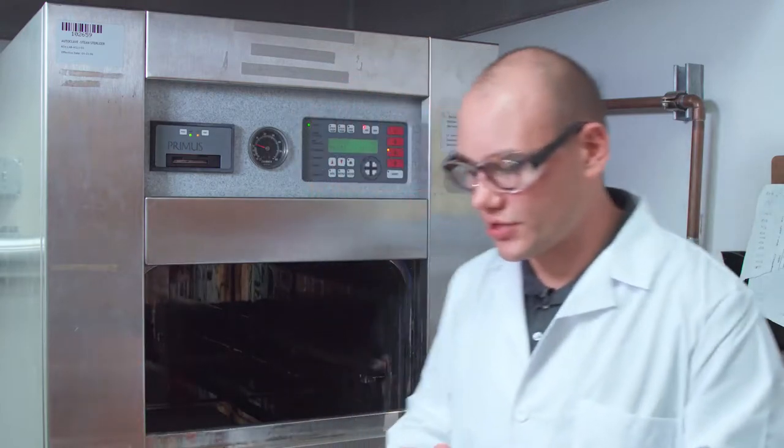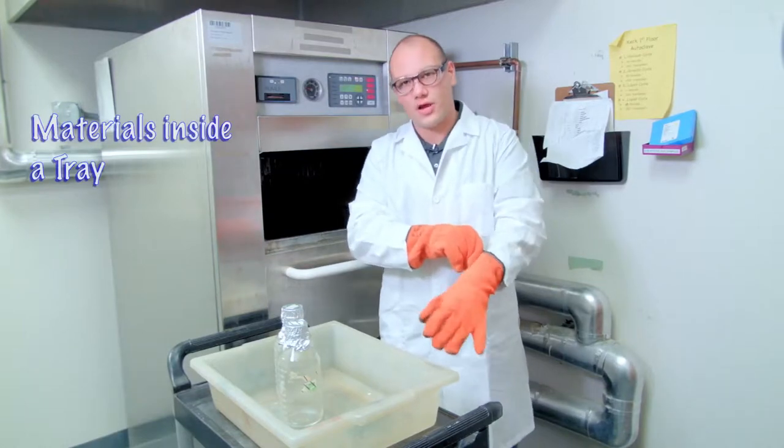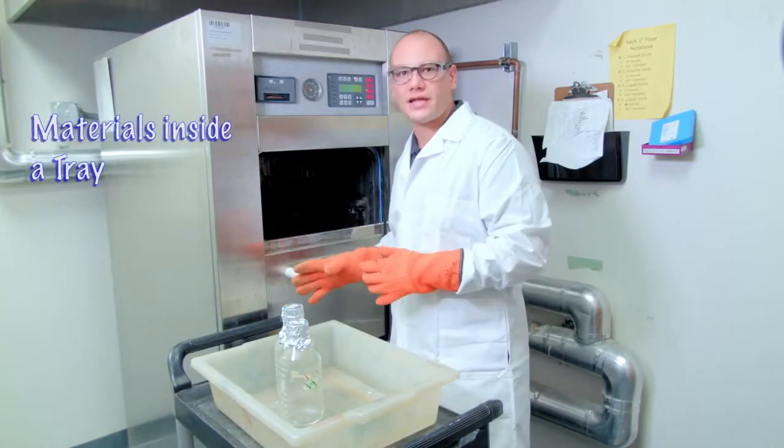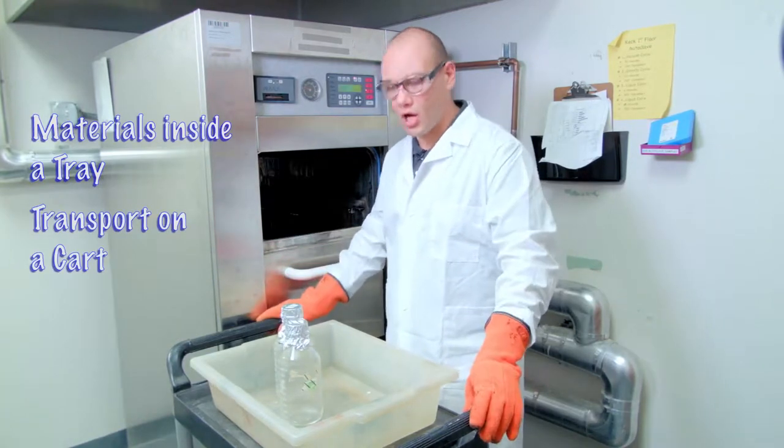Always make sure to place any research materials that are going to be going inside of the autoclave inside of a tray. Make sure to bring the research materials into the autoclave room and out on a cart.